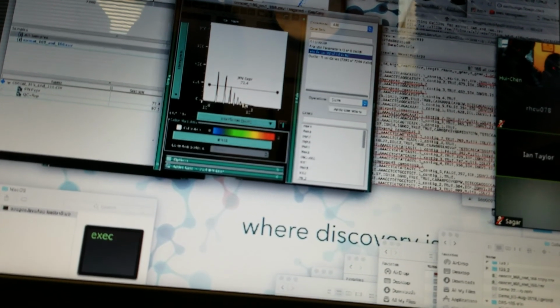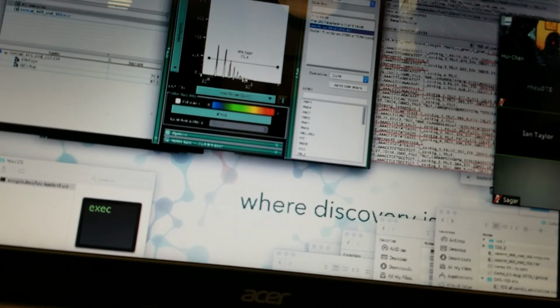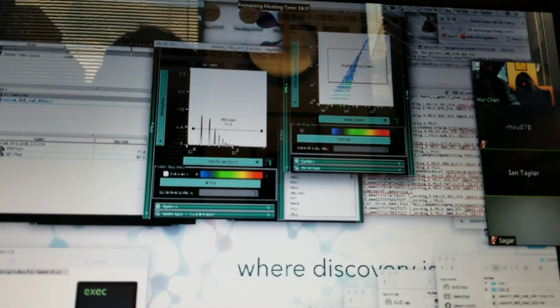Oh, wow, that's good. That's interesting. I wonder which one it is. I mean, one of them is in abundant. Is there a way to show which one of those genes is contributing the most to that?